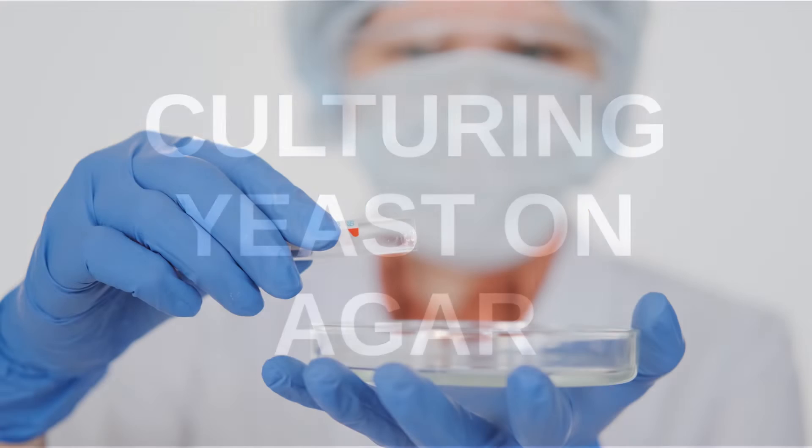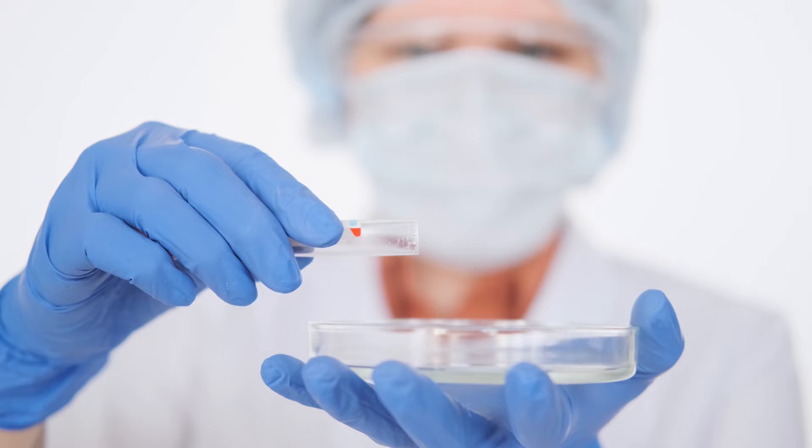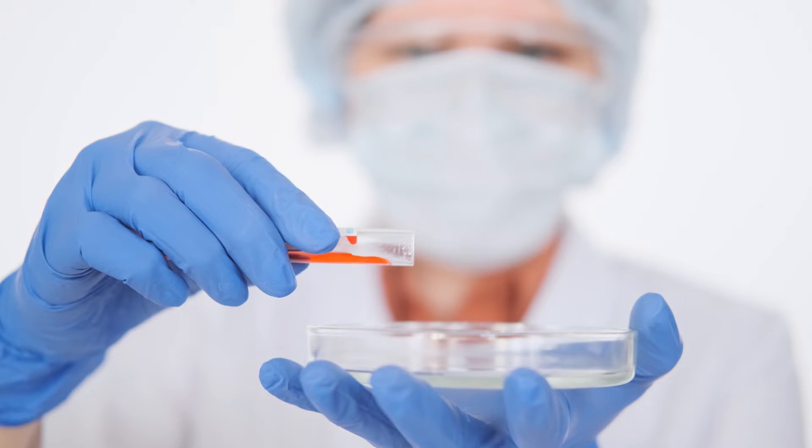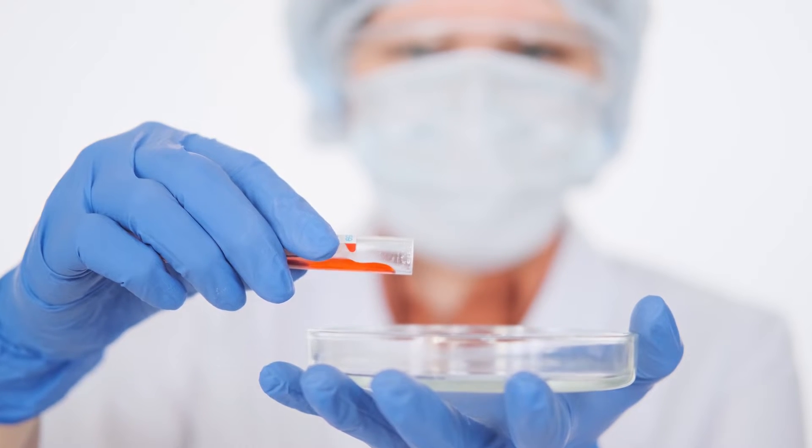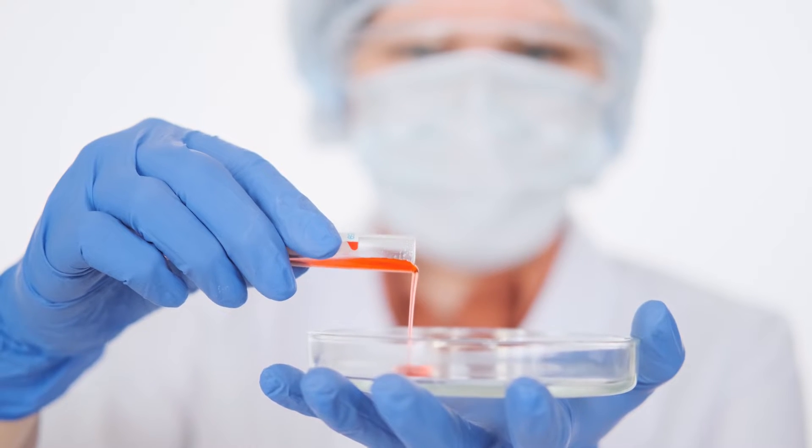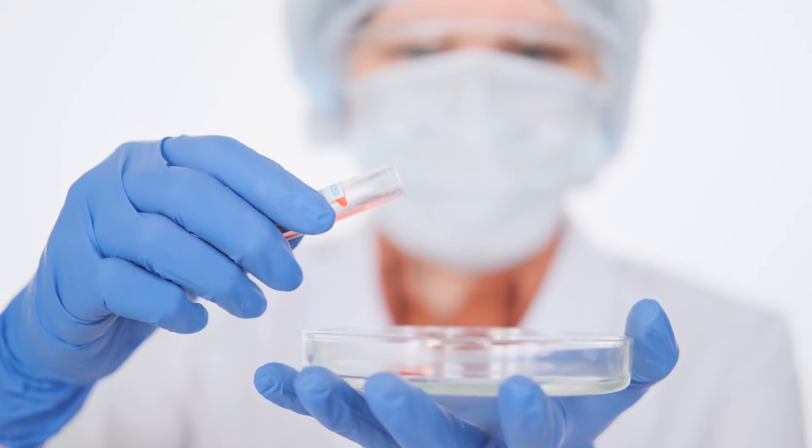Hello and welcome to this video on how you can culture your yeast strain of choice using agar. Agar, or more accurately agar agar, is a gelatin-like substance that is used widely in microbiology as a semi-solid substrate. It is supplemented with a variety of nutrients, minerals, sugars and more to support a wide range of microbes. In this case, it is rather obviously for yeast.